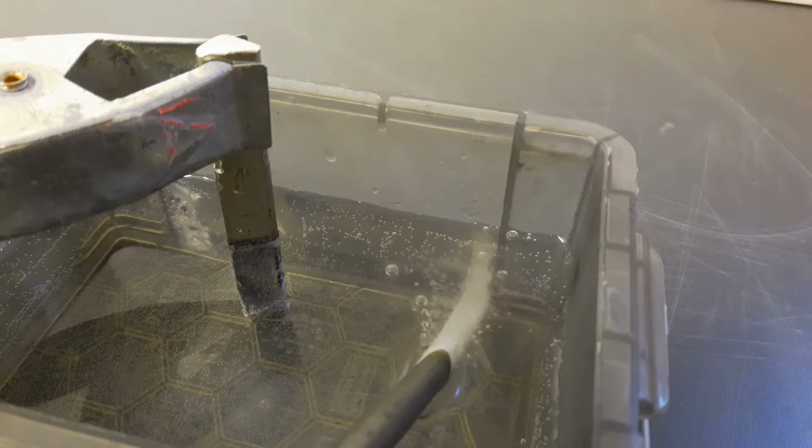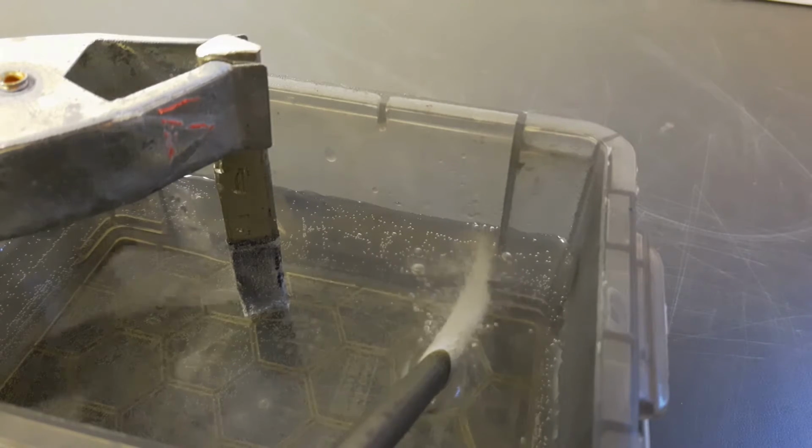So, the impossible is done. Two elements with different potentials are being reduced at the same time. Seems to be just randomly.